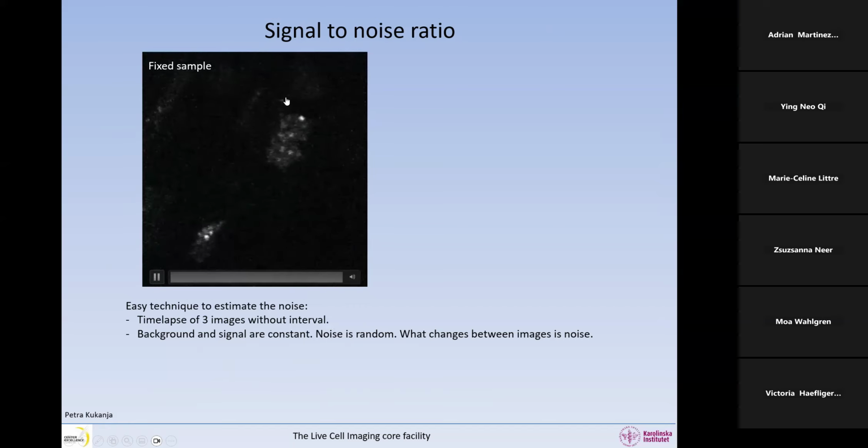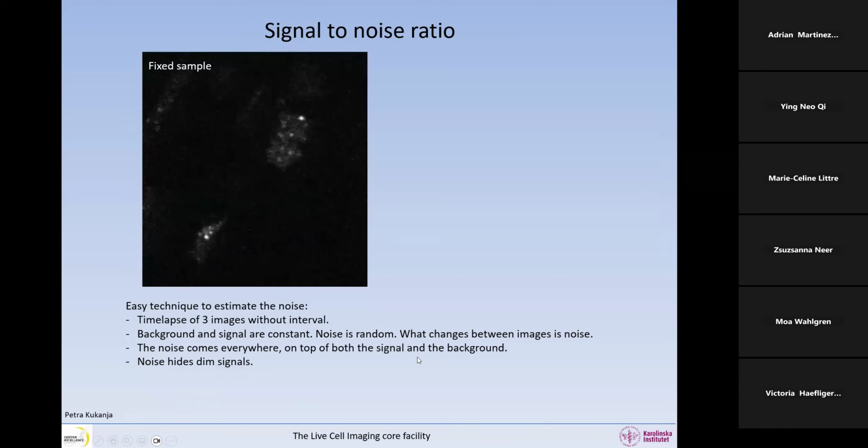So this is what we are doing when we are using this little technique. We are visualizing the noise. The things that change between images is the noise. The stuff that is always the same in the background is going to be background. The things that are always the same in the brighter areas, this is signal. But the noise comes all over the image. It comes everywhere, and it comes on top of the signal, and it comes on top of the background as well. It comes everywhere randomly from one image to another. And unfortunately, it hides dim signals.